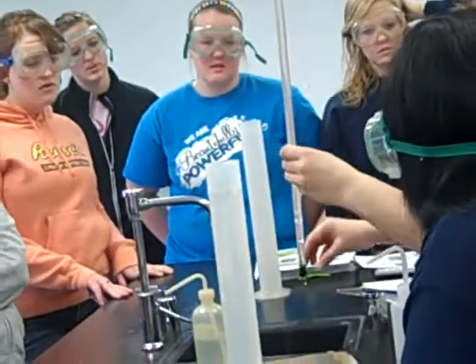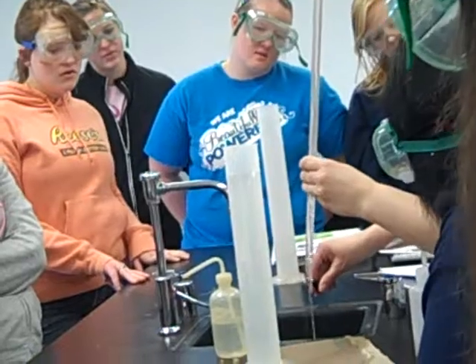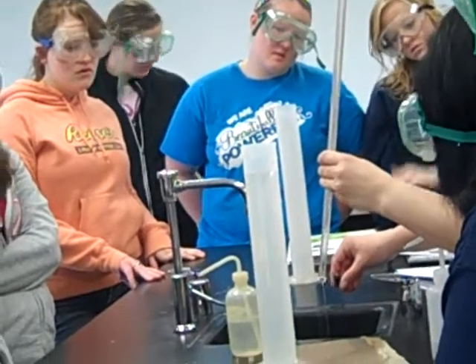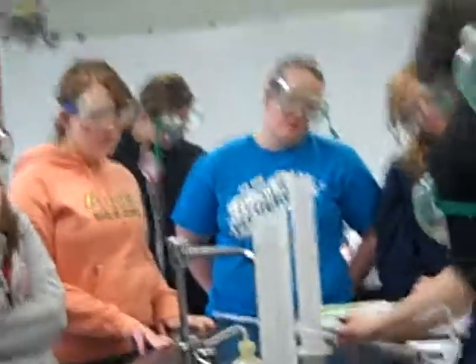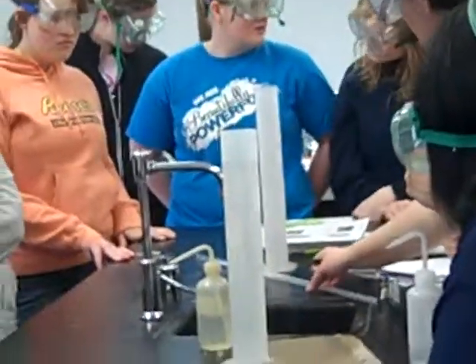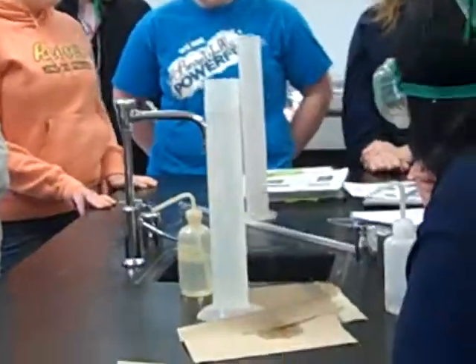There are more bubbles than before. Can you see if that's opened most of the way? It would — it would. One match. Just one match to test the collected hydrogen gas.